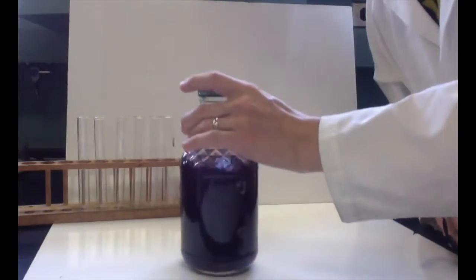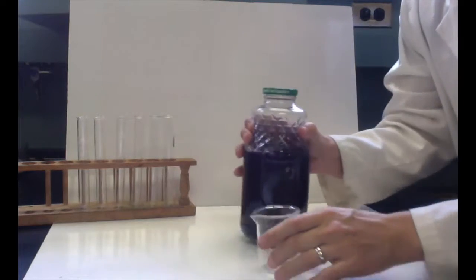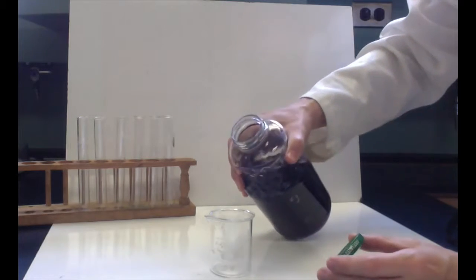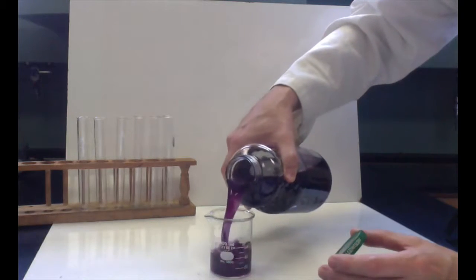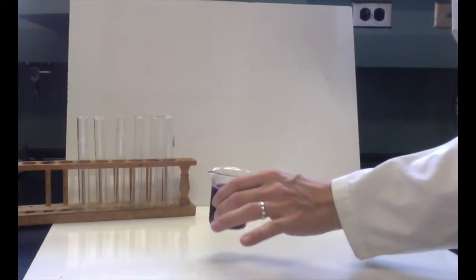So here's the red cabbage juice in question, right here. I made it last night out of a red cabbage that I cut up and boiled, and it looks like pretty good grape juice. There's the red cabbage juice.